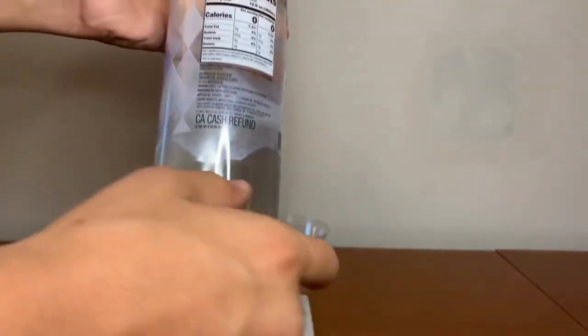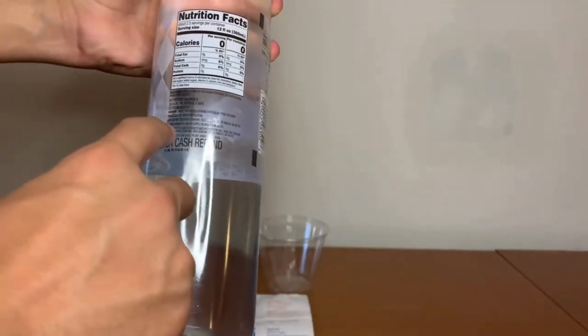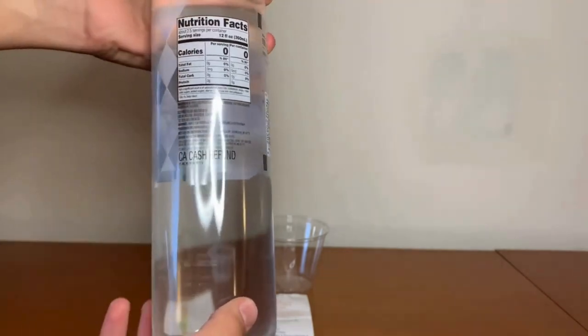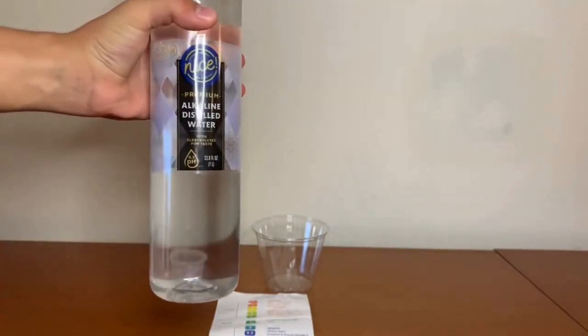Also on the back it says that the source is in the municipal water supply in Plymouth, Michigan. Let's test and see the results.